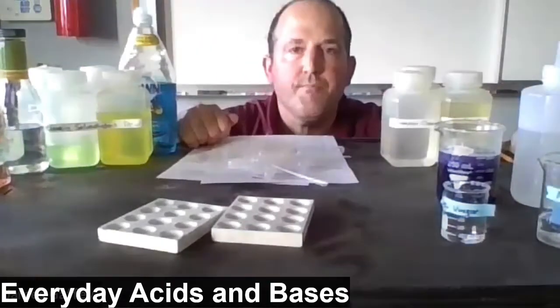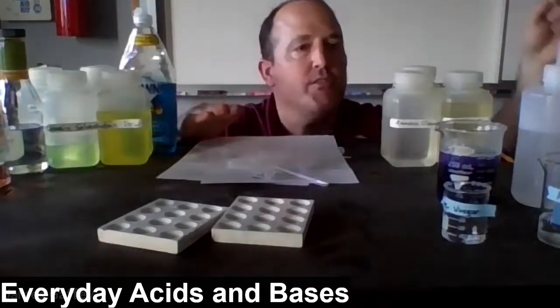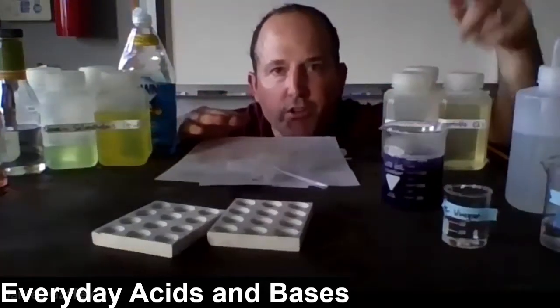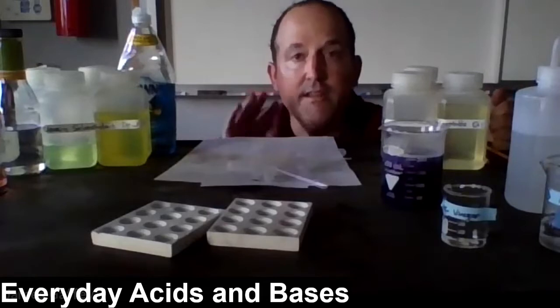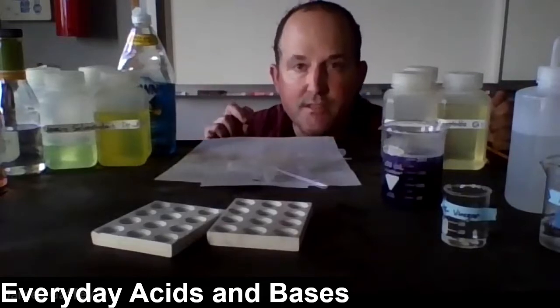Okay, students, so the cabbage juice has had a chance to heat up and boil for a few minutes. I've poured it into this beaker. Notice it's purplish on its own. What we're going to do is mix it with a known base, a known acid, and water, and see what color it turns. Those are going to be our standard solutions.